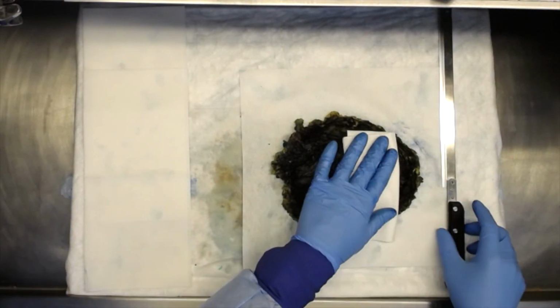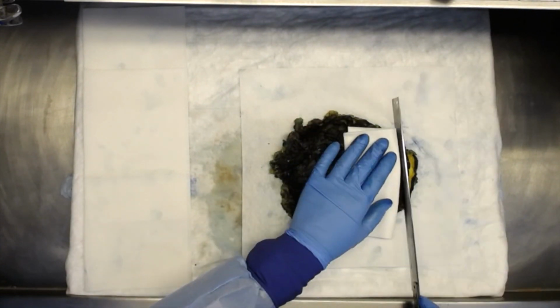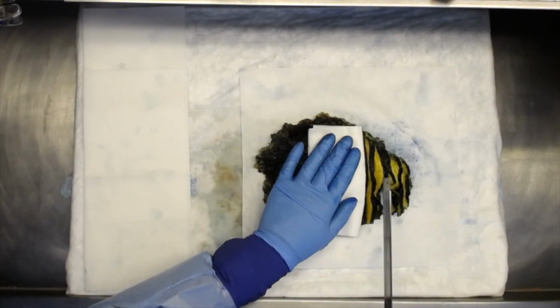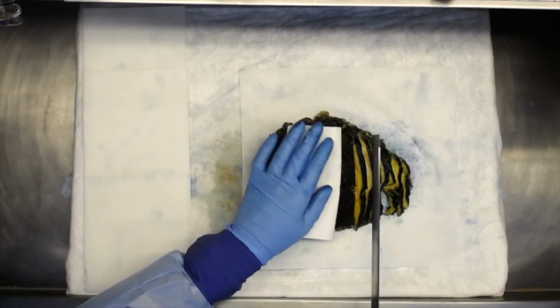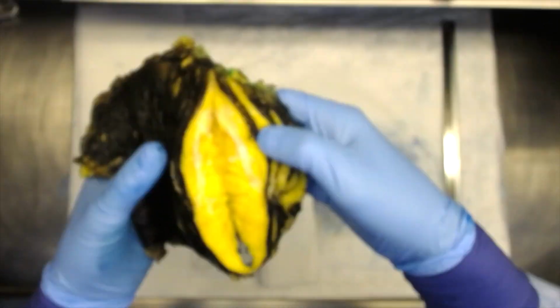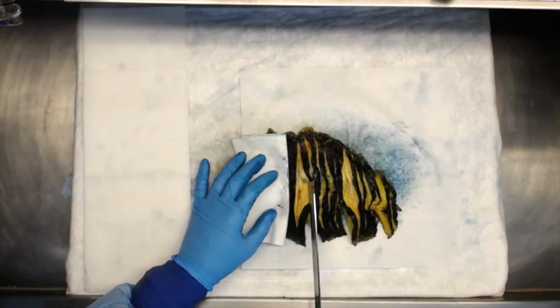Using an adequately large and sharp blade, thinly section the mastectomy specimen through the deep/posterior aspect as shown here, approximately 0.3 to 0.4 centimeter thick sections. Examine the cut surface of each slice to look for masses or lesions.